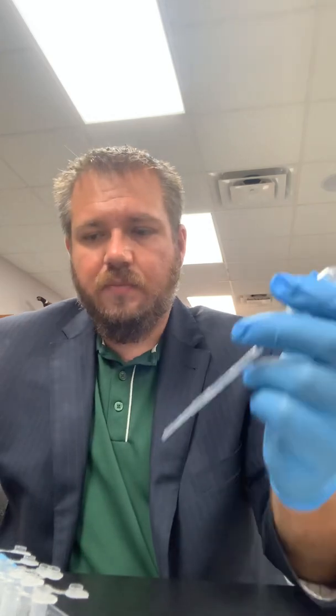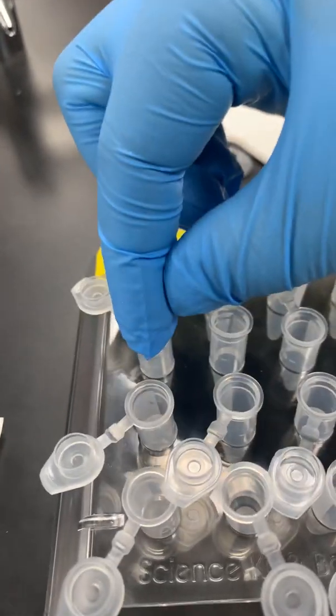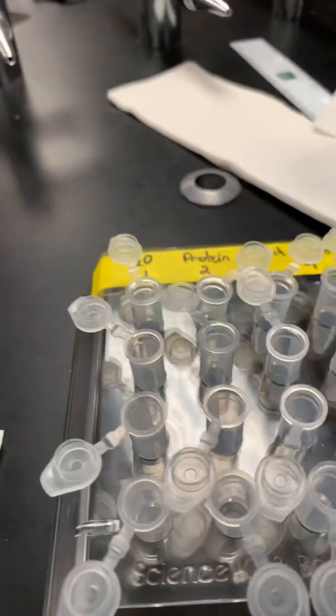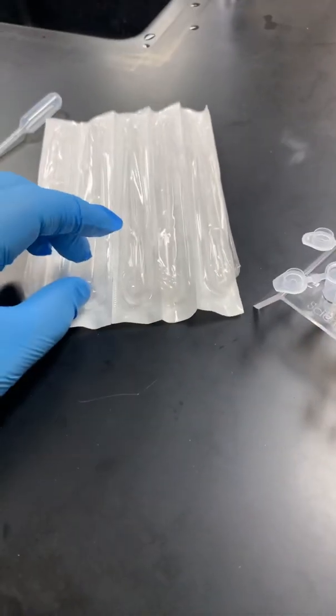Again, each time I'm drawing up the liquid into the transfer pipette and then dispensing it into the corresponding test tubes. So again, this was my stock that originally had 1.5. Now I've got half, and half a mil of water. I'm gonna do the same exact thing except with a different pipette. Again, I don't want to mix my water and my protein. I don't want to mix my starch and my protein, and so on and so forth. So that's why you have multiple transfer pipettes.